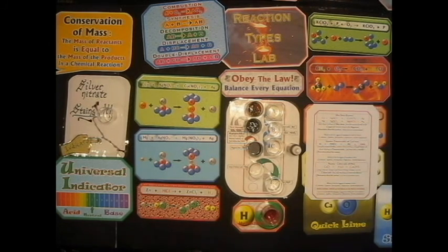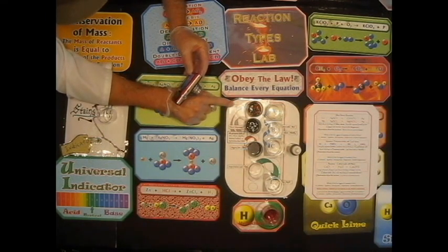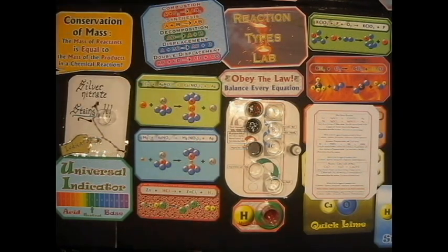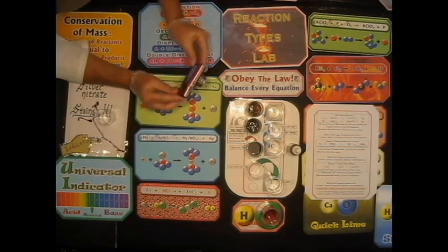What if I were to tell you that all of this gross gray stuff coating the other metals and sometimes on the bottom is silver? Really? Yes, that is silver. So silver is being kicked out of the silver nitrate. That gives you a pretty good idea what kind of reaction it is, by the way. And there it is.